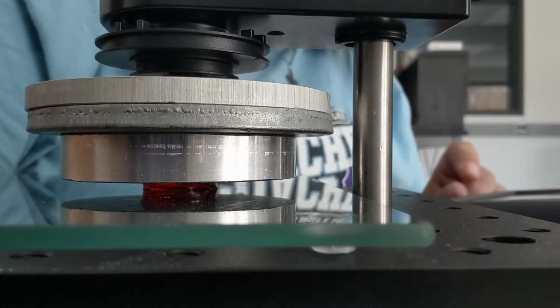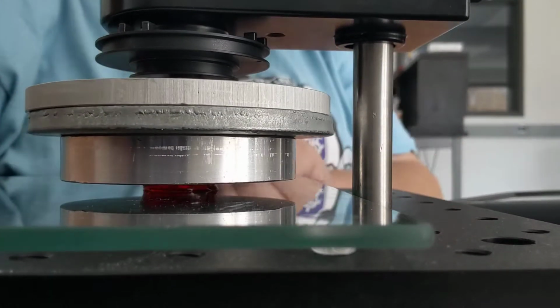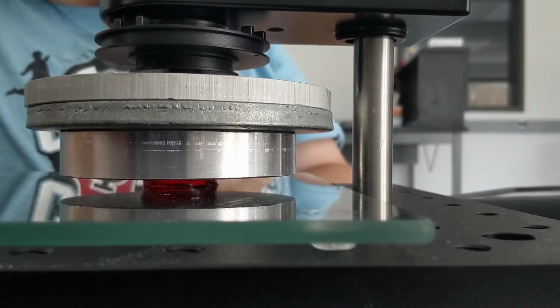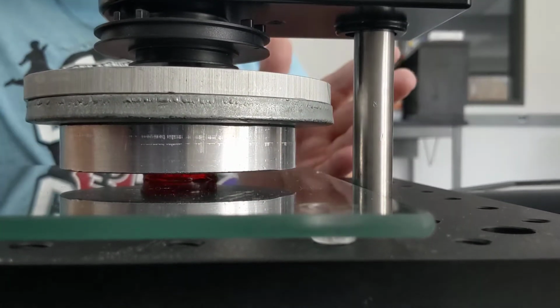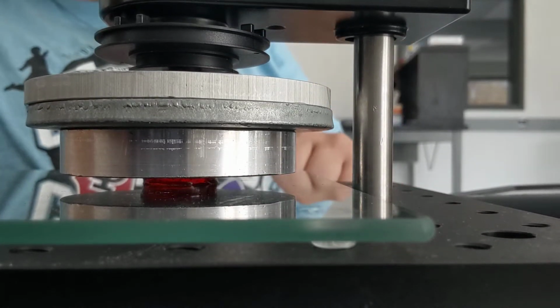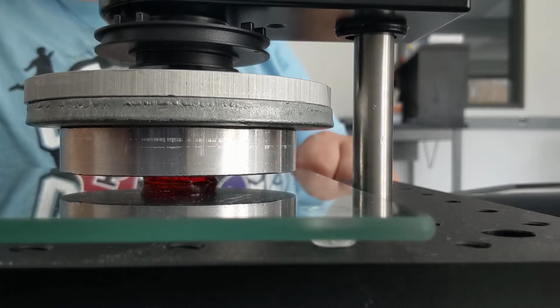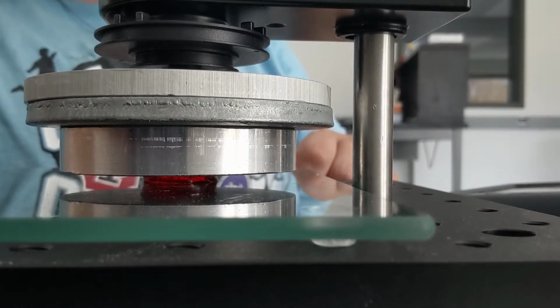So I'm going to apply a small torque to that disc and allow it to oscillate back and forth. You can see it oscillating there. Now, if the sample wasn't there, the disc would just move in a circle, and the sensor would make measurements of angular displacement, velocity, and time.